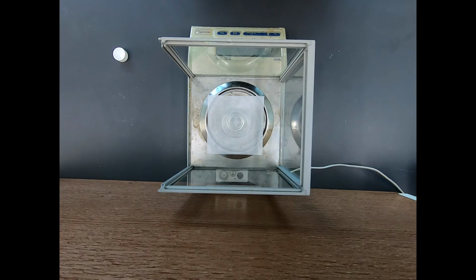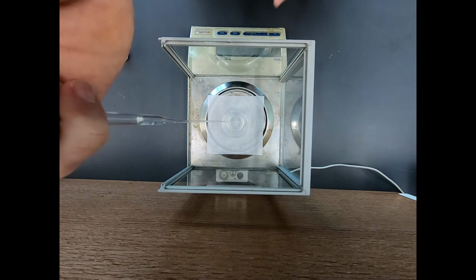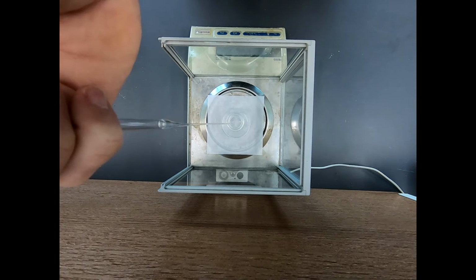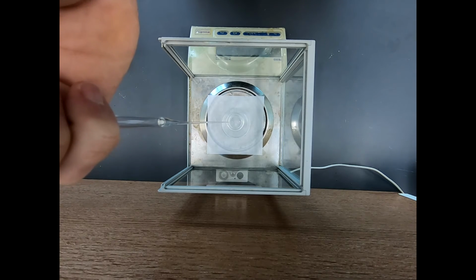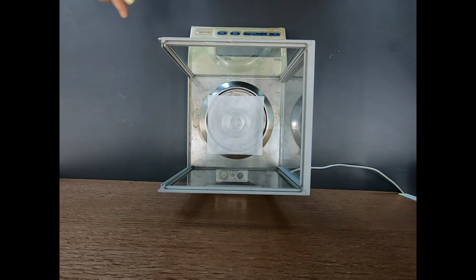So there's a gram. We want about half of that again. Drip, drip, drip. You can't quite see this readout here, but we're doing okay. It's 1.3. Let's go slowly. 1.45. 1.47. We're getting closer to me just saying we're done. Okay, one more. That is 1.49 grams. That's fine. We just need to know exactly what that is.